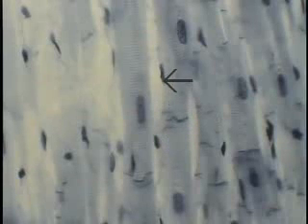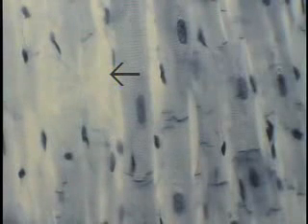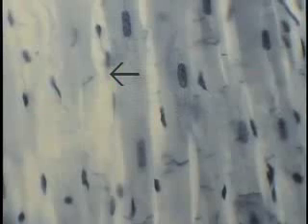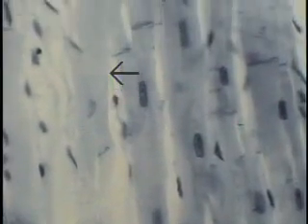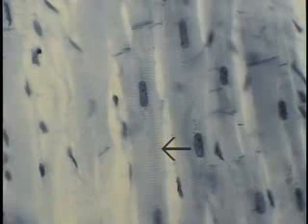These intense, dense nuclei, such as indicated by the pointer, are those of endothelial cells. Please do recall that this is an extraordinarily vascular type of tissue, the myocardium, and on either side of these cardiac muscle cells is associated a capillary. Having demonstrated these particular features on this special preparation, now let's see if these same things can be observed on a relatively routine preparation.